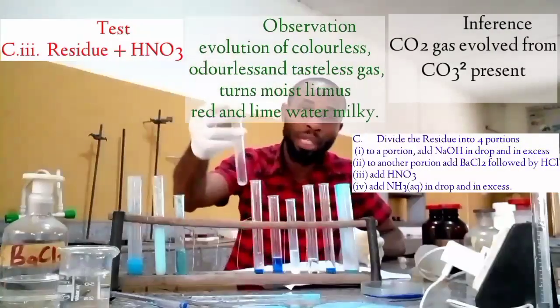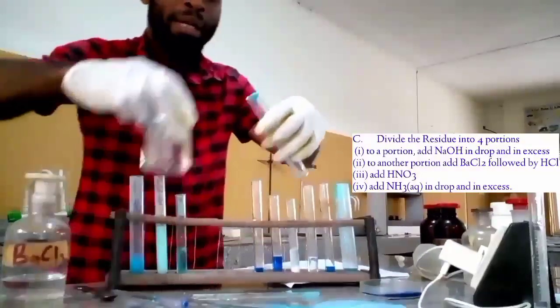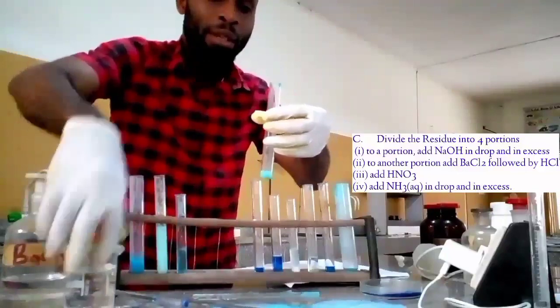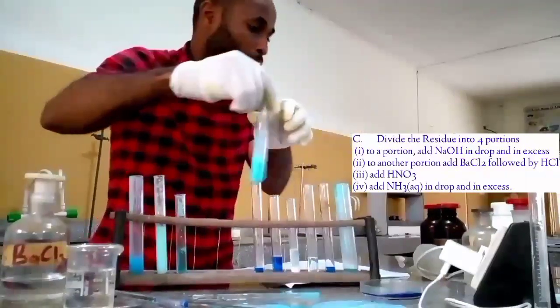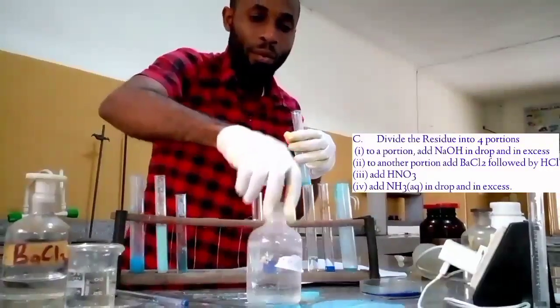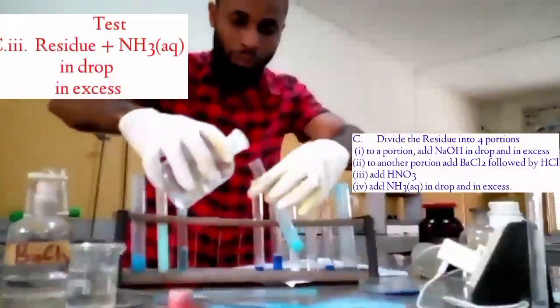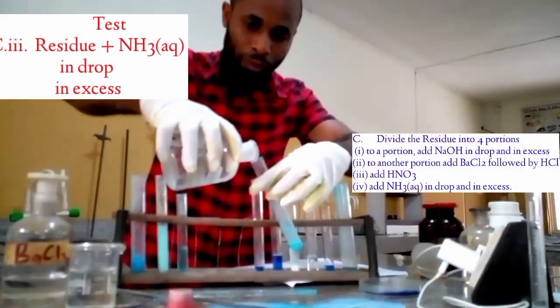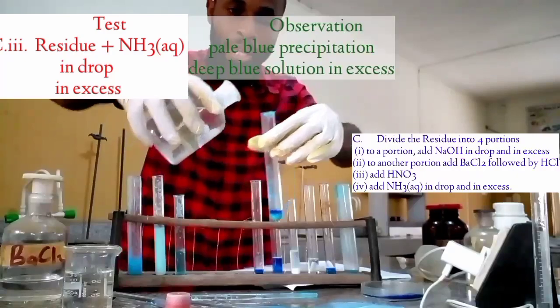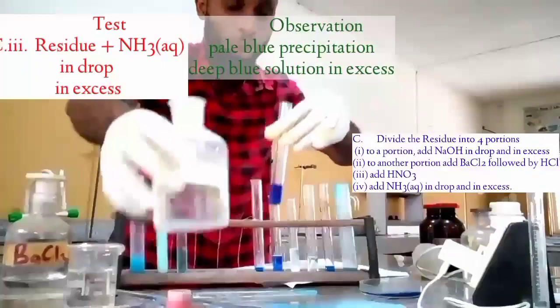They can ask us to add ammonia in drops and in excess. Let's add this in drops and in excess, see how it is going to look like before I conclude this video. Okay, let's go in drops and in excess. This is my ammonia. We go. That is a blue. Then if you add it in excess, a blue solution.